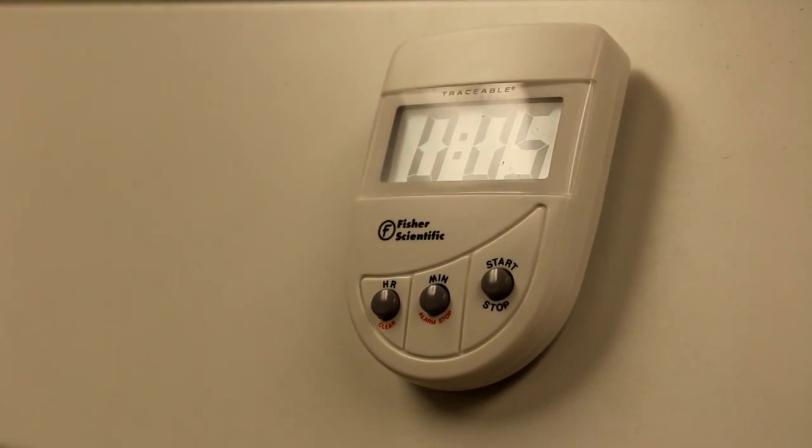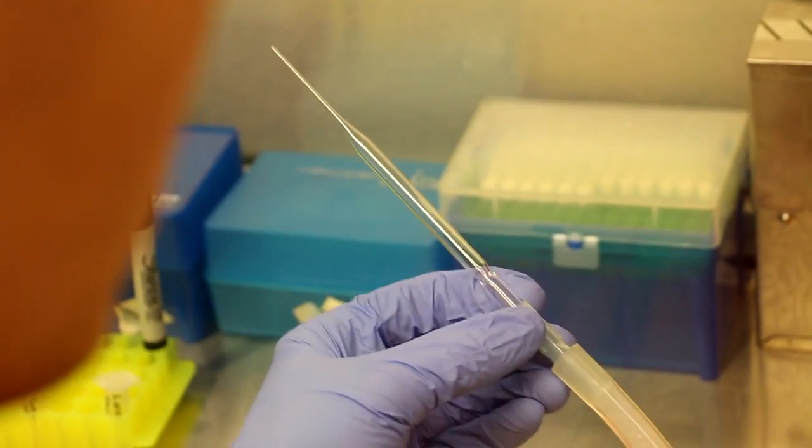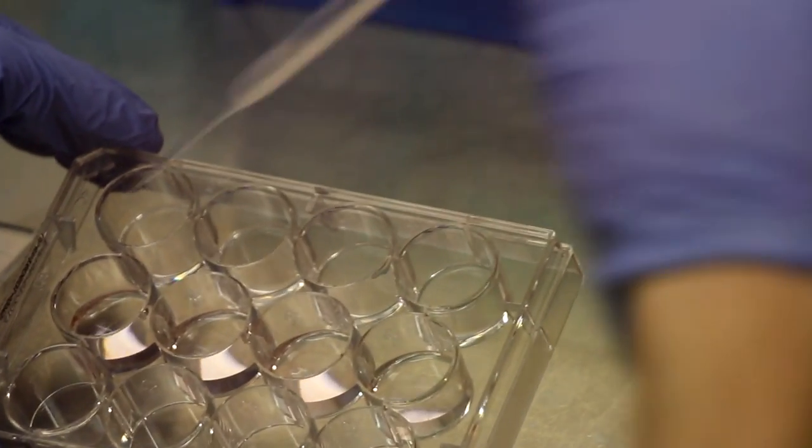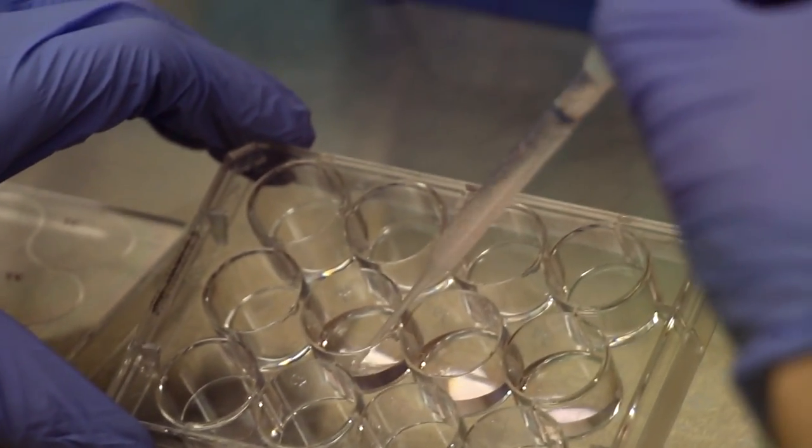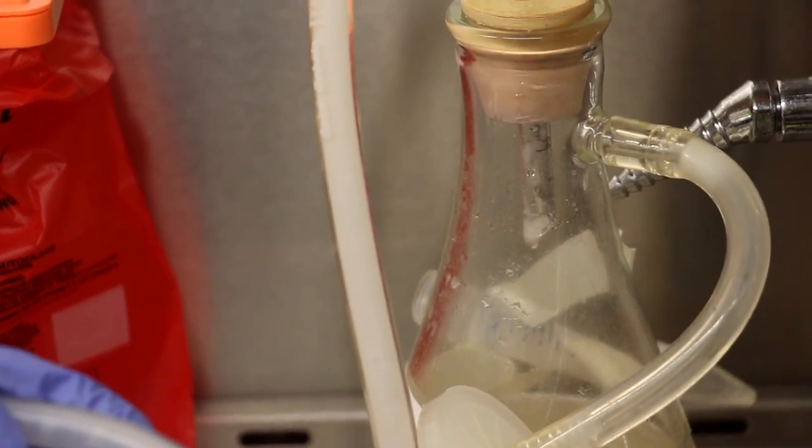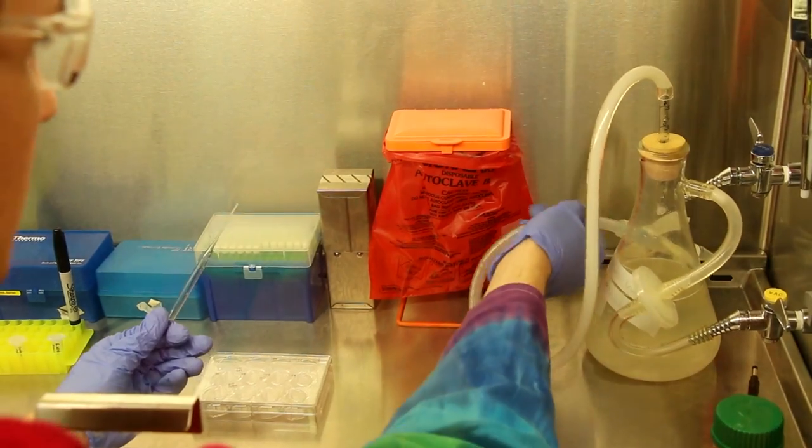During the 5-minute incubation, go ahead and aspirate the media from all wells of your 12-well plate. When you're finished aspirating the media from your 12-well plate, remember to properly dispose of the aspirator tip.